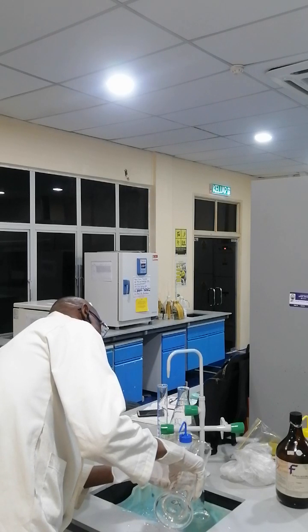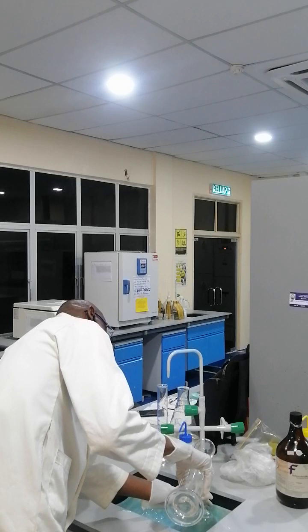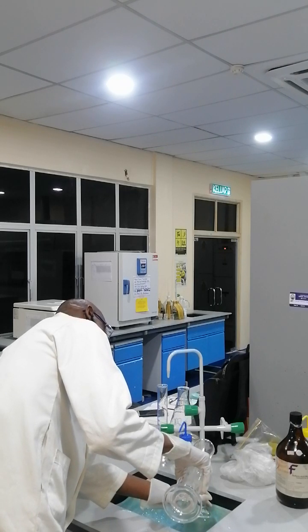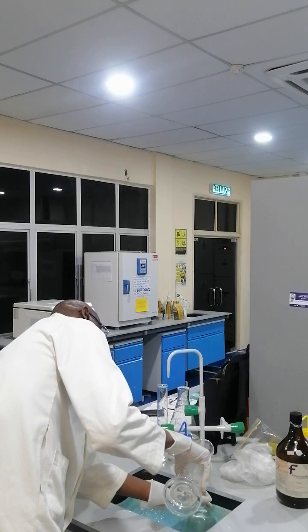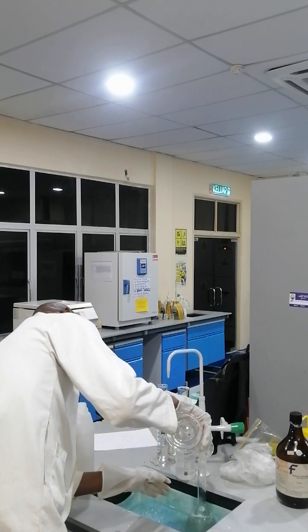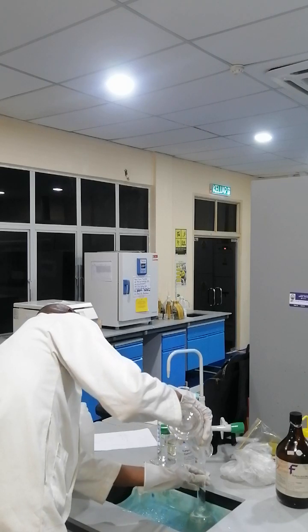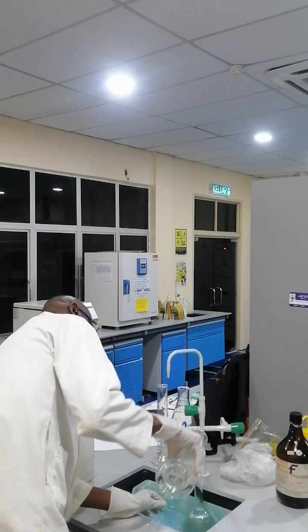Sometimes you may hear some hissing noise because of the corrosive nature of the acid.